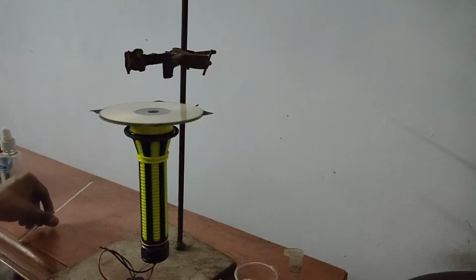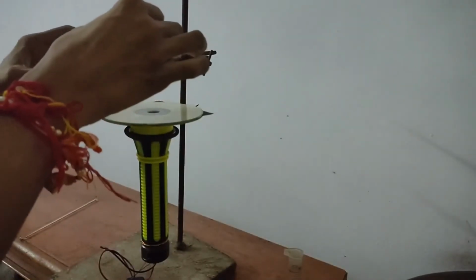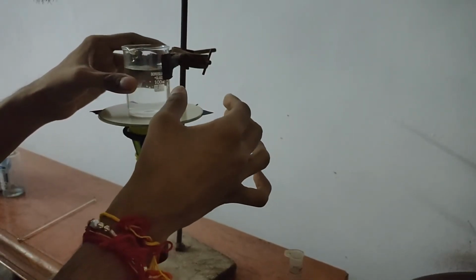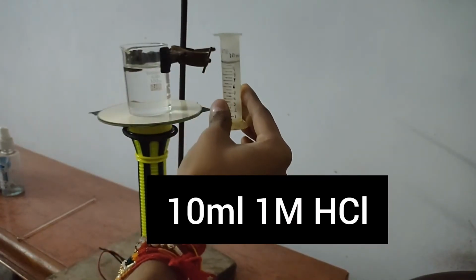This is our sun. Now I place the beaker which had sodium thiosulfate solution on the top of that hole, and to this I will be adding 10 ml of 1 molar hydrochloric acid. Now on turning on the flashlight, you can see that light passes through the solution and forms a white colored spot which is our sun on the ceiling. So this is our sun which is now white in color.